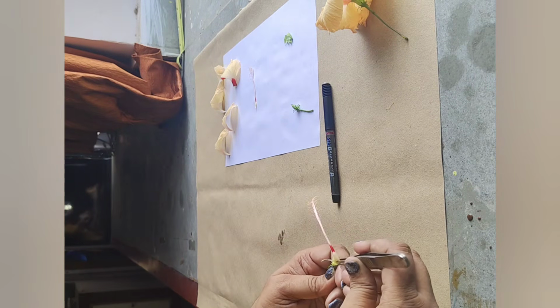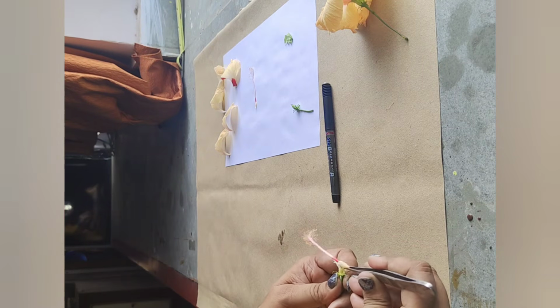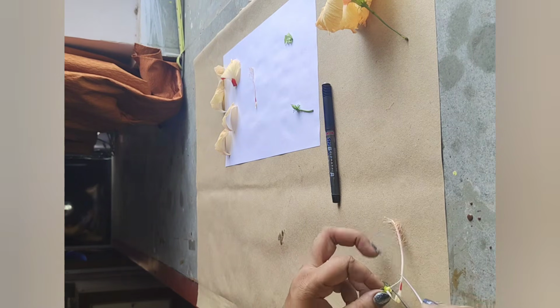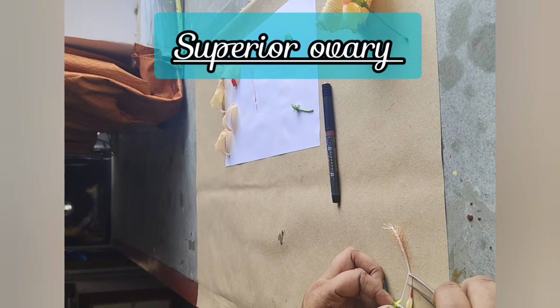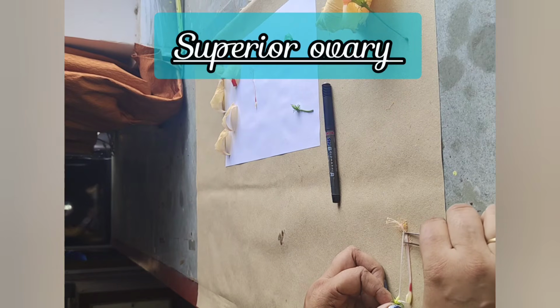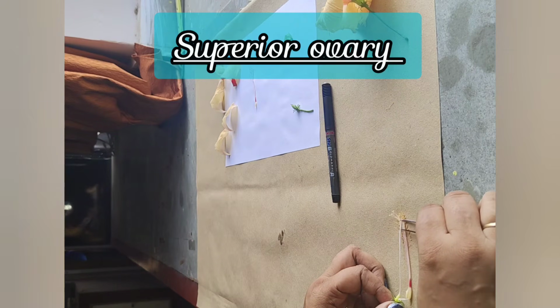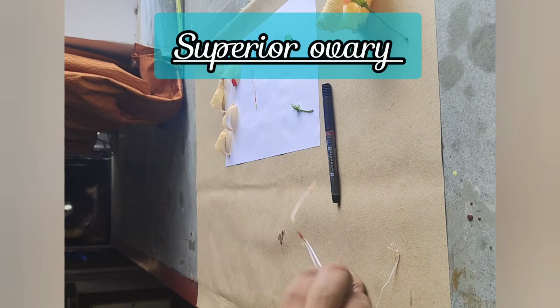This portion of the dissection we have to perform very carefully, because if we perform it in a hurry, we will end up breaking the style of the gynoecium portion.